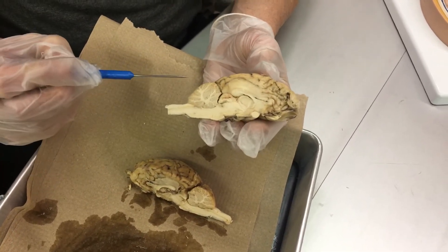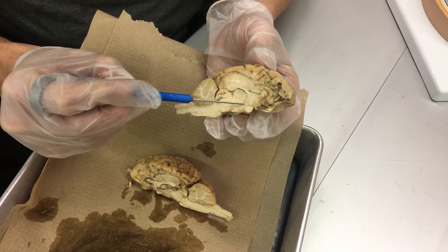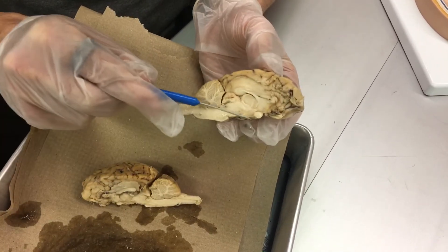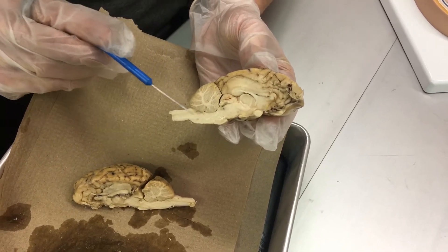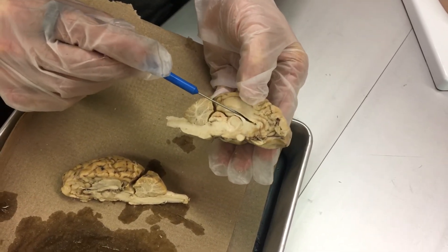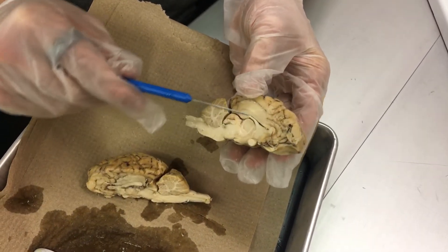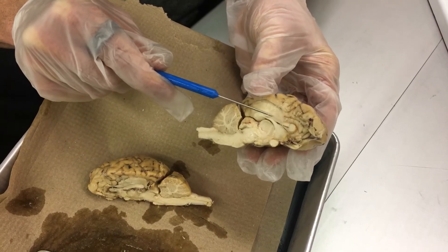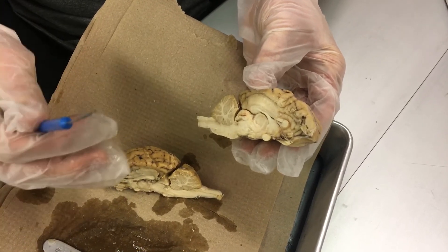Inside the brain, we have the thalamus right here and the hypothalamus right below it. The pituitary, which I believe is cut off on both sides, would be right in this area hanging down. Then you have your midbrain, pons, and medulla. This white area right here — you can kind of see a separation — that's where the lateral ventricles are and cerebral spinal fluid flows through that area. And then you have your corpus callosum, which is a pretty prominent white area right through here. That is where axons go back and forth from the right and left hemisphere so that each side of the brain can communicate with the other.